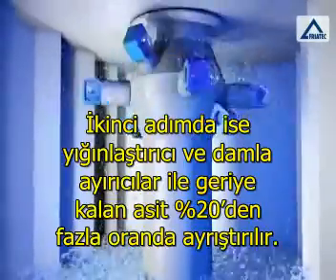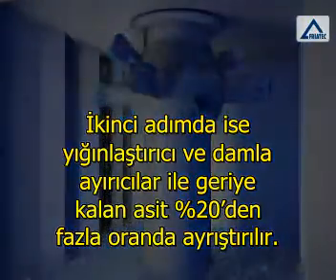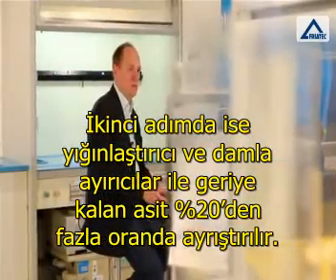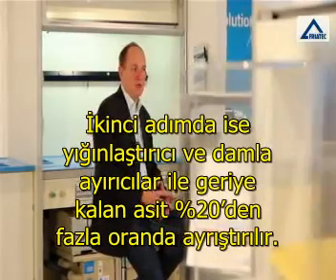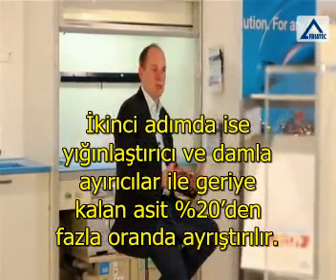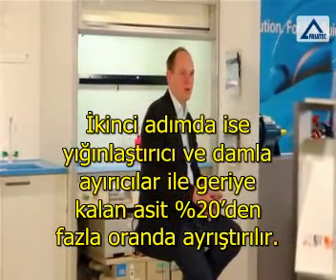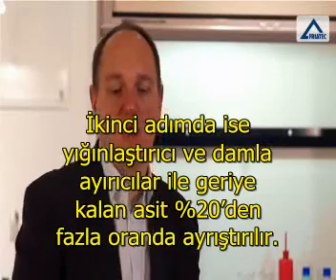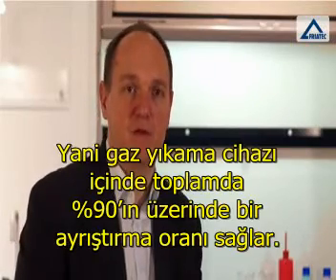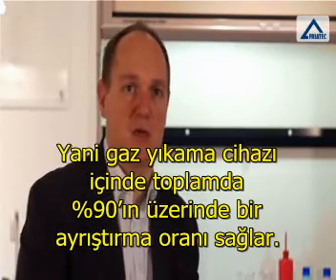After this, we have a second step of separation with agglomerators and mist separators that also reduces the rest of the acids by more than 20%. So in general, we have an efficiency of more than 90% separation inside the fume scrubber.